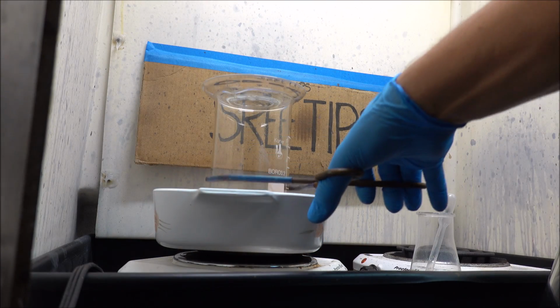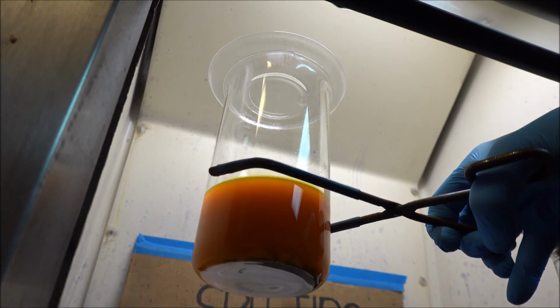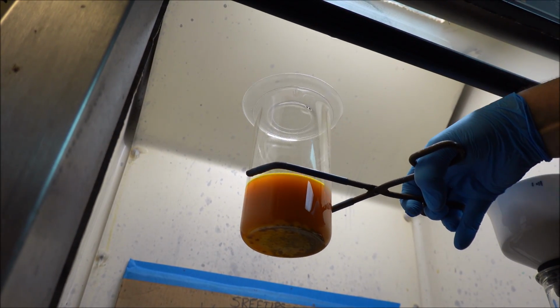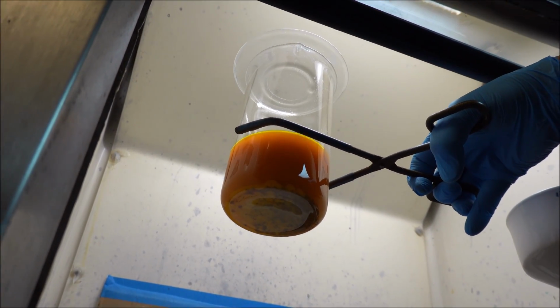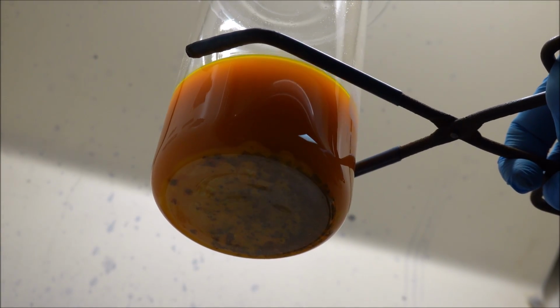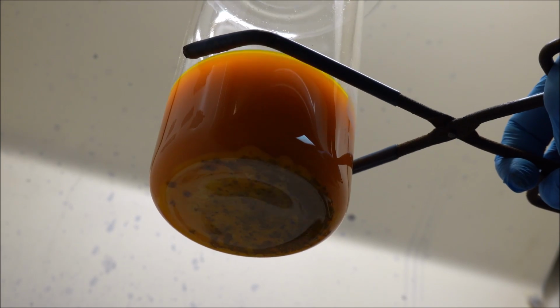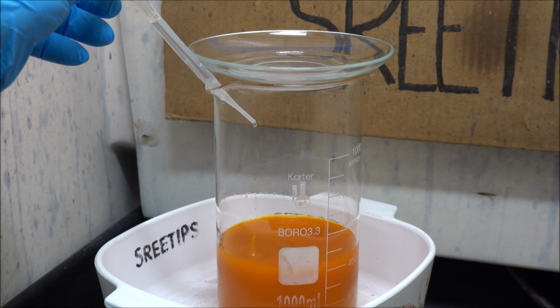All right, we're going to take a look at our solution here underneath. And if you can see there, I've still got a bunch of gold on the bottom of that beaker. Looks like some silver chloride as well. So we're going to continue to add nitric acid here until we get everything to go in the solution. Adding some more nitric here, see if we can get the rest of the gold on the bottom of that beaker to dissolve.